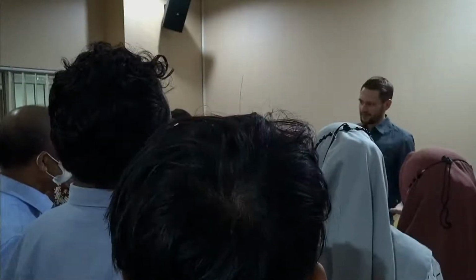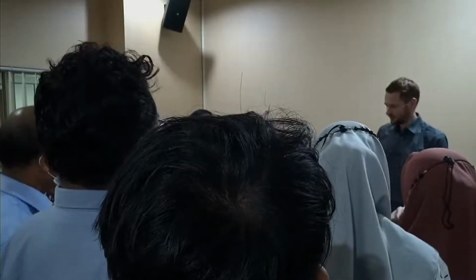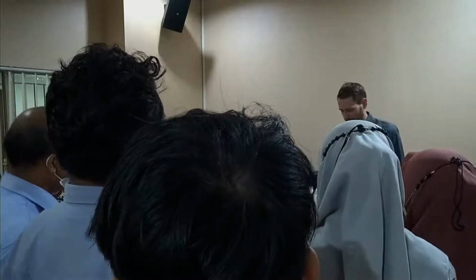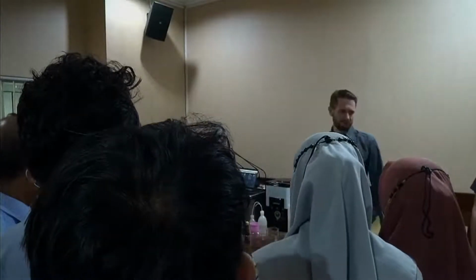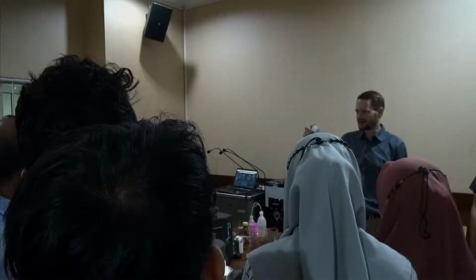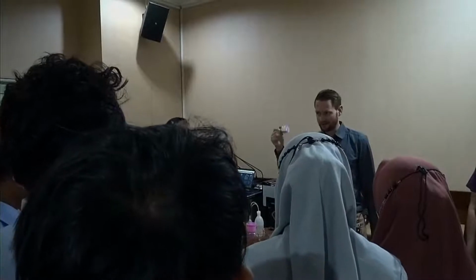And this is one way we can ensure that you have a possibility to check and to do everything without constantly spending money on the way all the time. So, of course, this can be empty at some point, but here the entire box is, I actually have no idea, do you know? The price? Yeah, I think the entire box is below 100 euros. But with this you can make thousands and thousands of measurements.